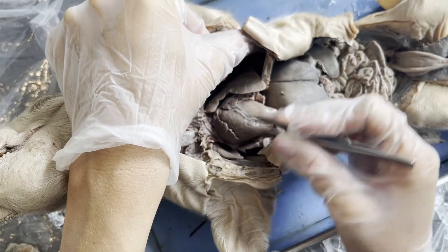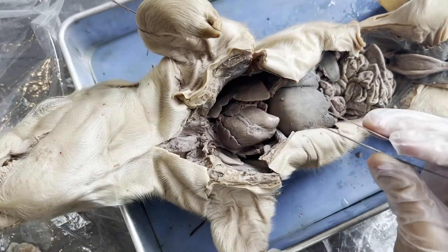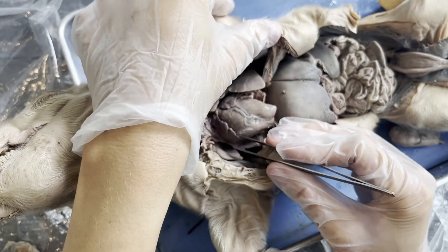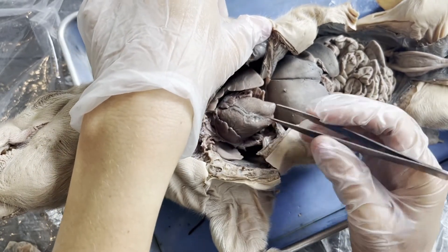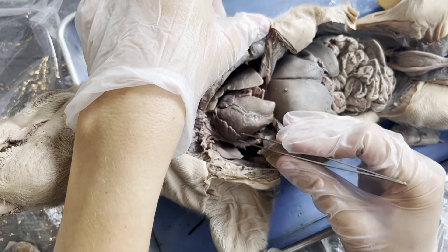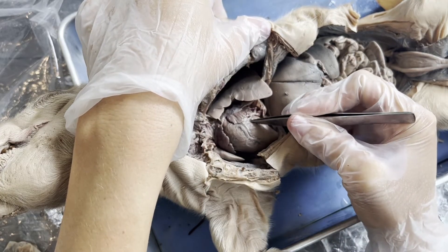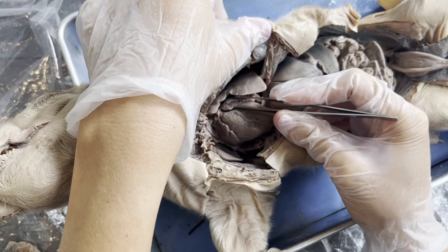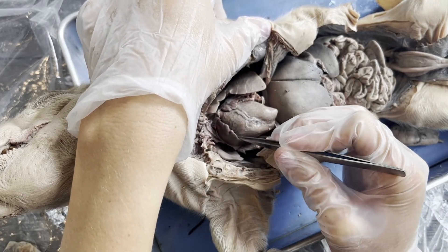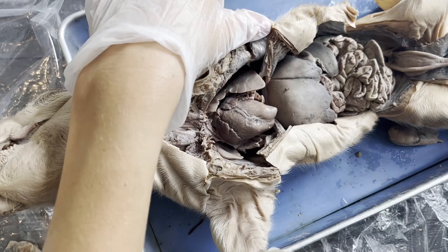But what are these ear-like looking flaps? These structures are known as auricles. Auricles are often mistaken as being the same thing as the atria, but they are not. The auricles are extensions or projections off of each atrium. So if the right atrium is here, this is the right auricle. If the left atrium is here, this is the left auricle. These projections just increase the capacity of the right atrium and the left atrium so that they can hold more blood inside of themselves.